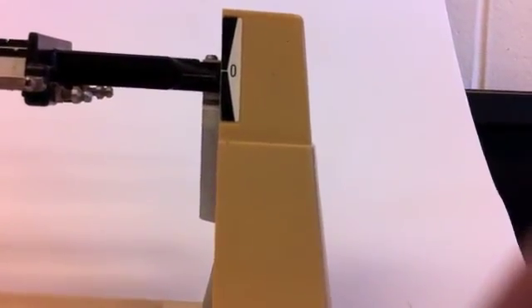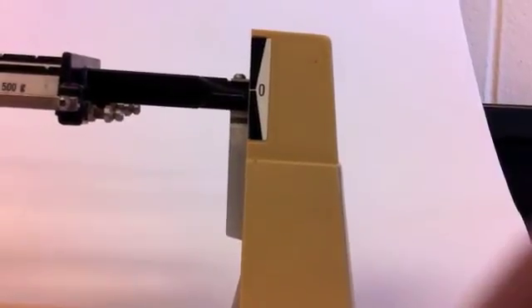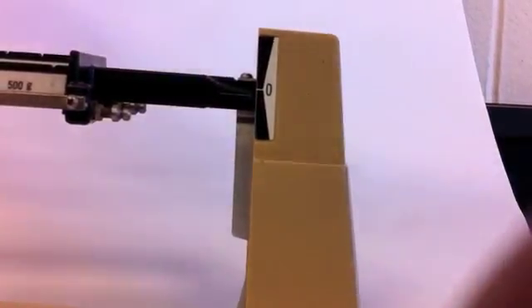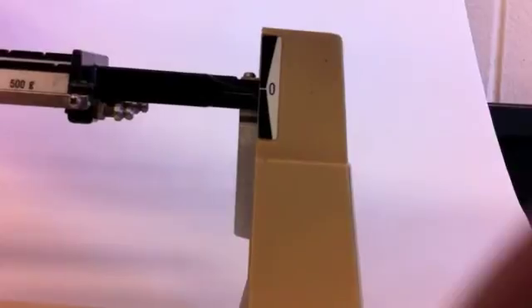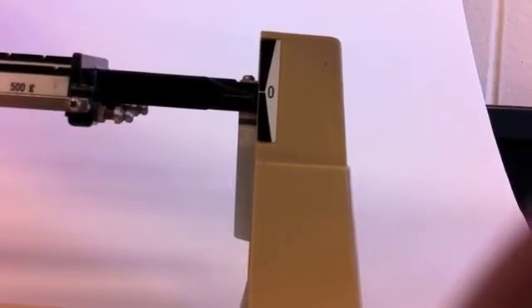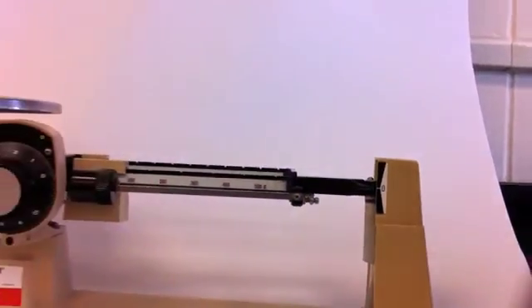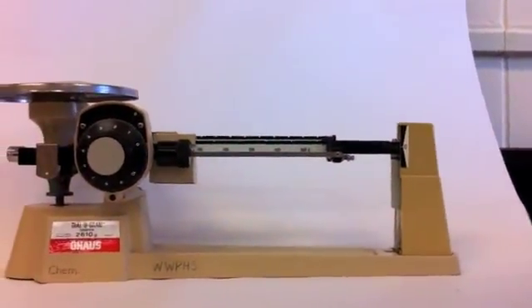Without spilling any off the paper, some chemicals will react with the balance pan. Also, if it's not on the weighing paper, you are massing things that you won't actually put into your reaction or into your reaction vessel. Okay, you can see now it is at zero, and my weighing is done.